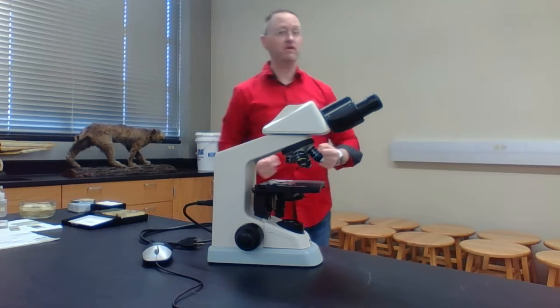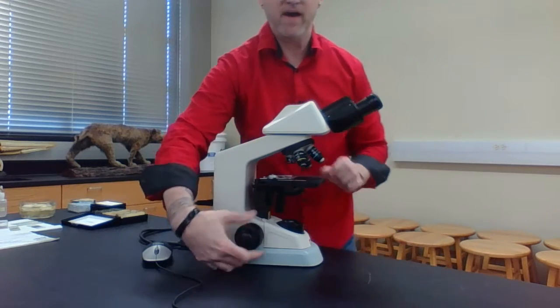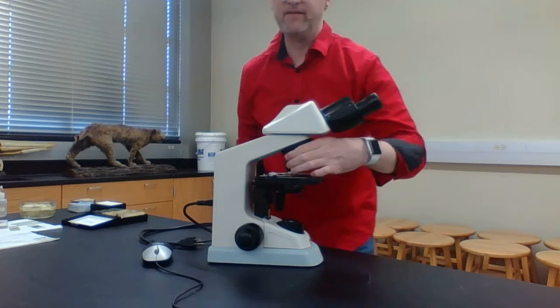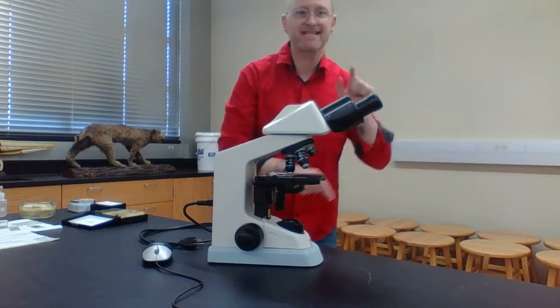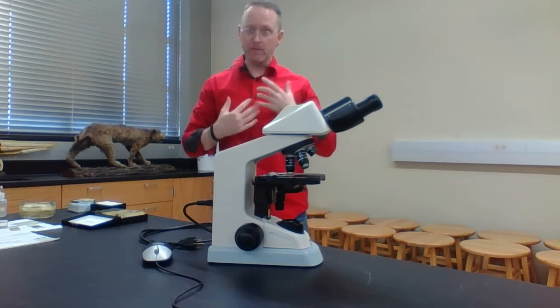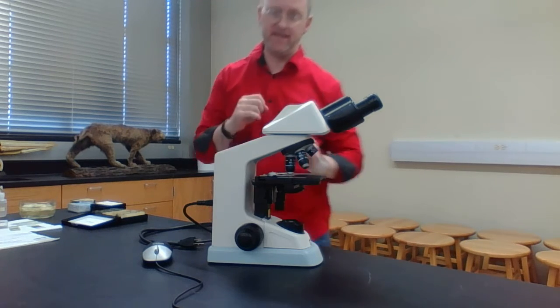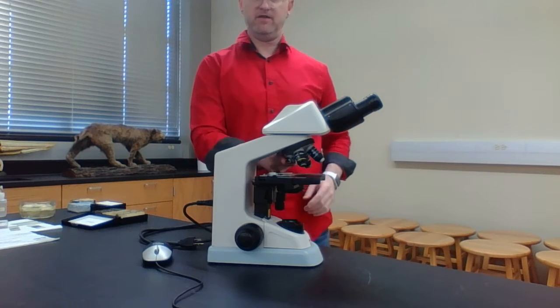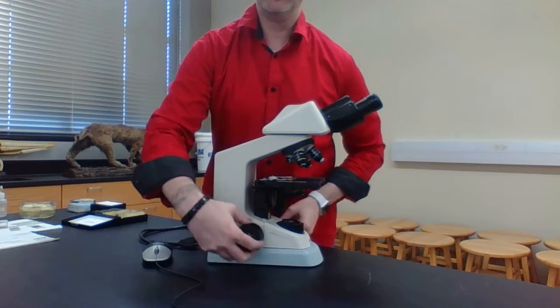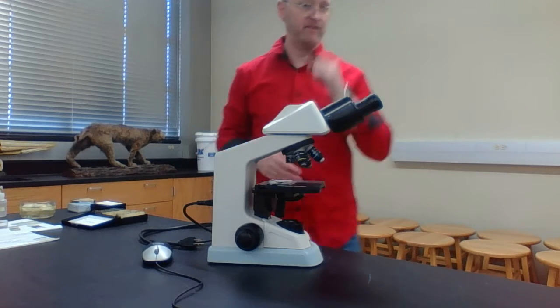So when you pull your microscope out and you see that it's all the way up here and it's under a different objective other than the scanning objective, whoever used it last did it wrong. You're my students. I don't want you to be messing up on anything. So once you're done with the microscope, make sure it's under the scanning objective, and then make sure that the stage is furthest away from the objective.